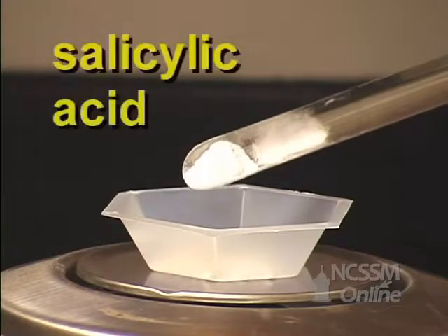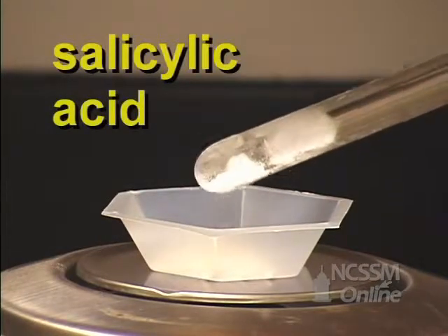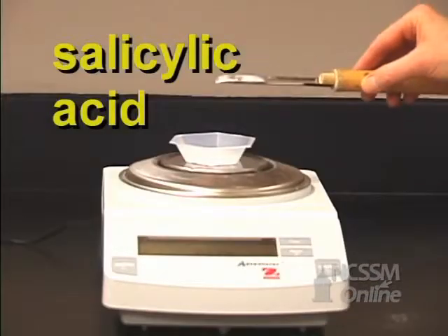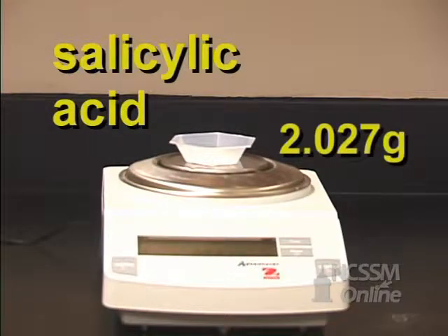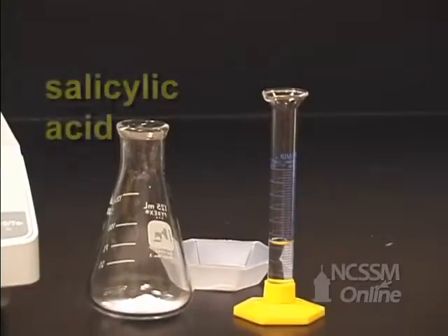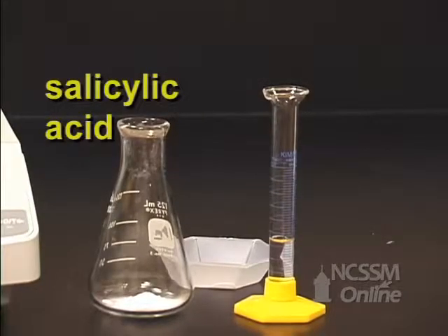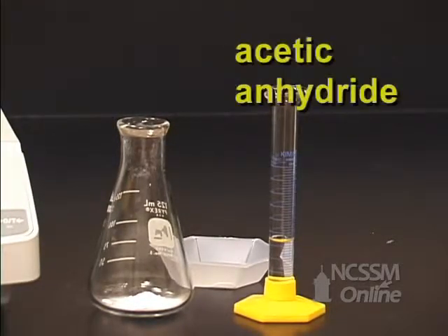We want to weigh out 2 grams. Actually we have 2.027 grams, so record that number.